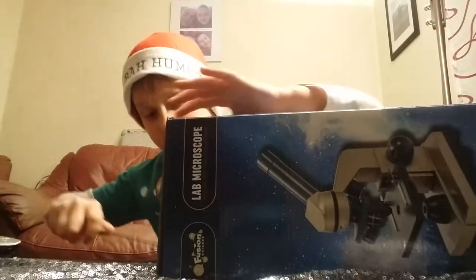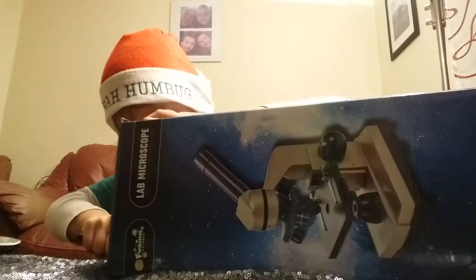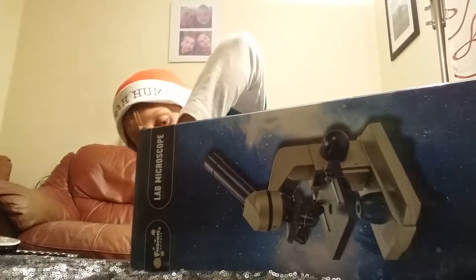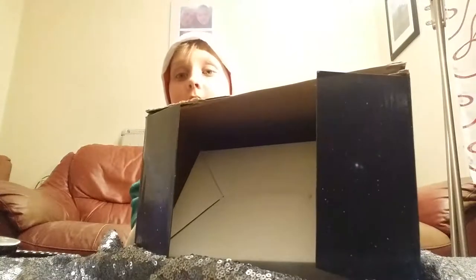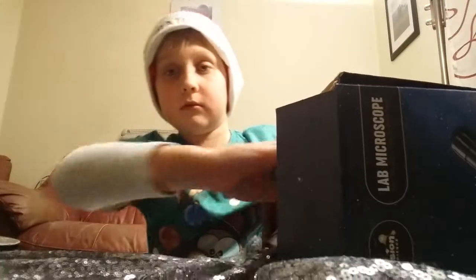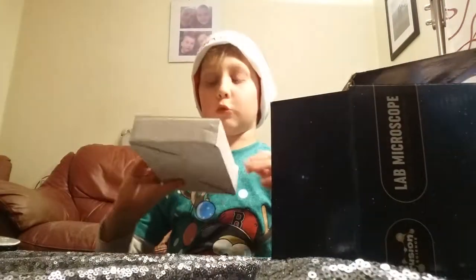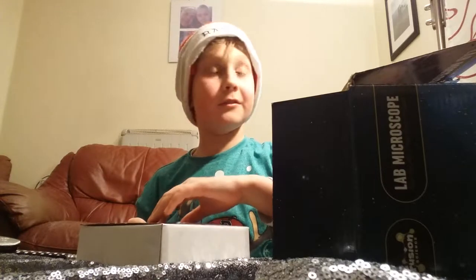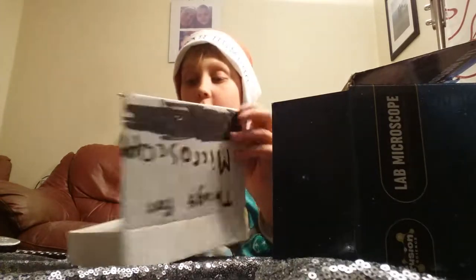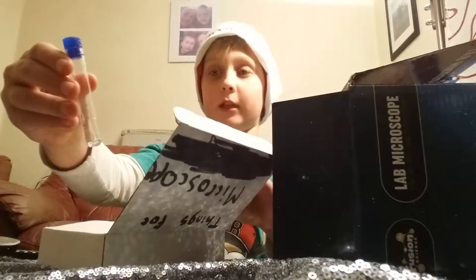Let's open it up. The box — I've already got all the tools. The power just went out and just came back. These are all the tools. There's a little potion thingy.